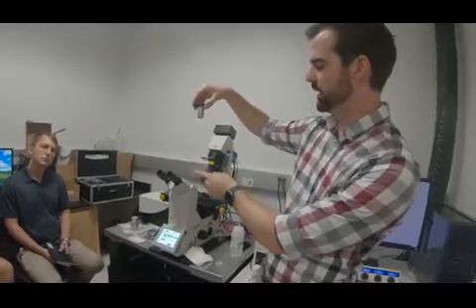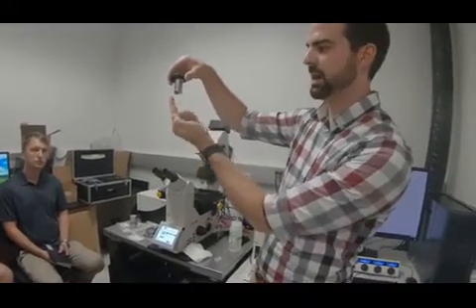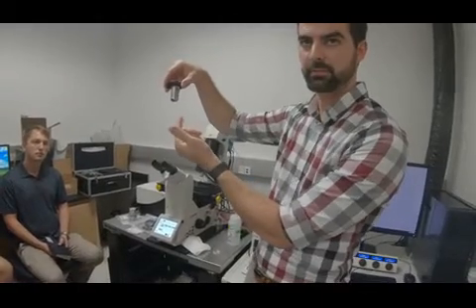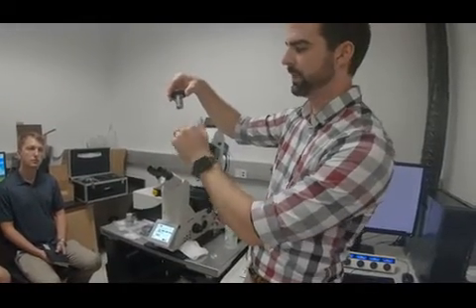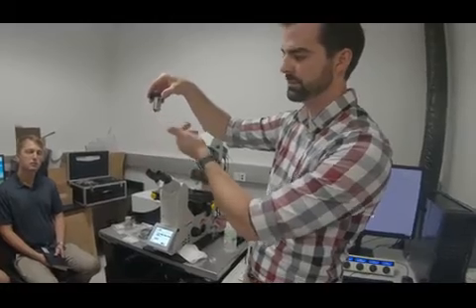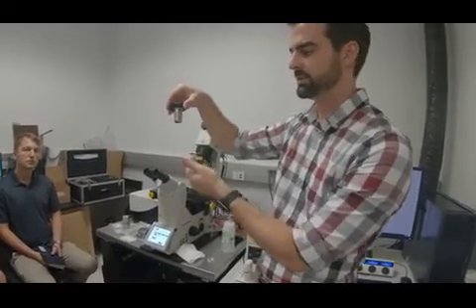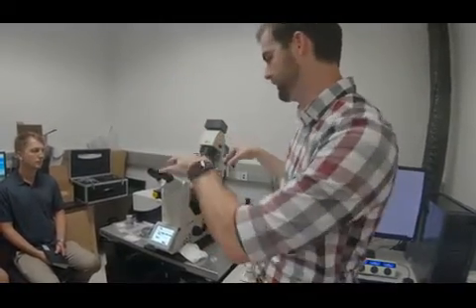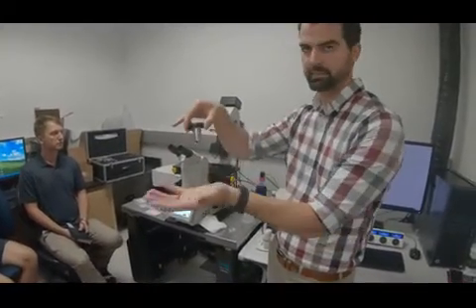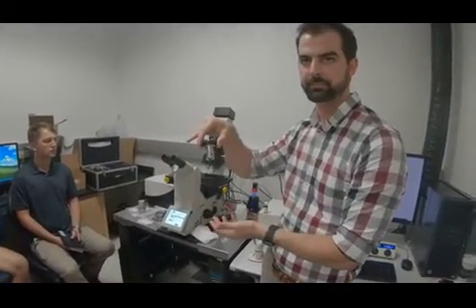We use the XY scan mirrors to raster scan that laser across the mirror housing really rapidly, and so you form a virtual light sheet. The rate at which it's raster scanned across the object is much faster than your exposure settings, so what the camera sees is a whole plane of illumination.